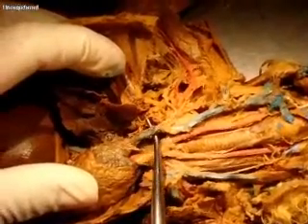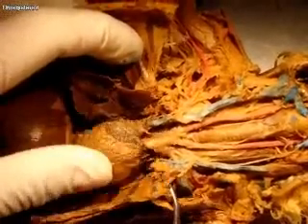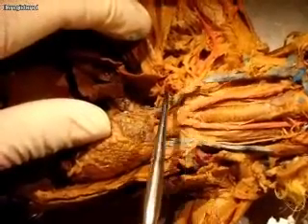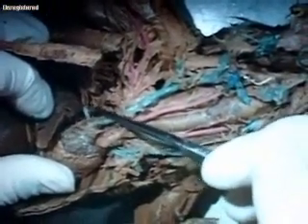This is the right cranial vena cava. This is an internal thoracic vein here. I'm not sure what some of these other ones are that have been pulled off. Is it the azygos? The azygos is right back here — this is the azygos right here. The azygos comes out from underneath the lung, coming from underneath the lungs. That's the azygos.